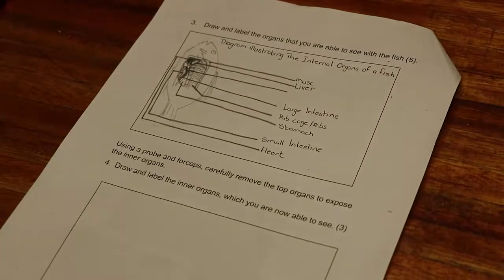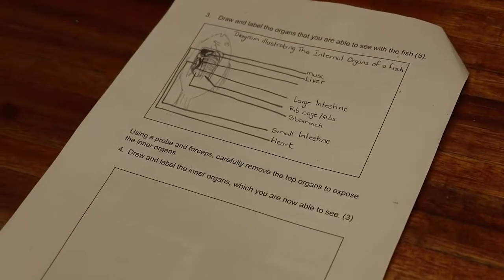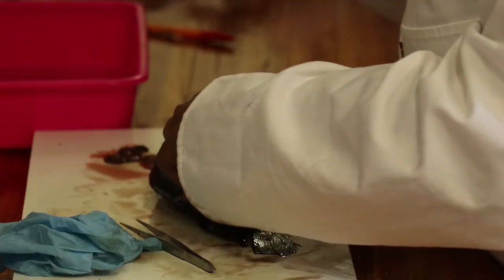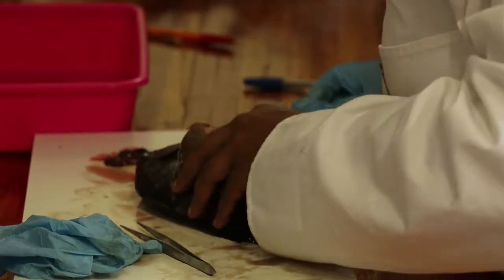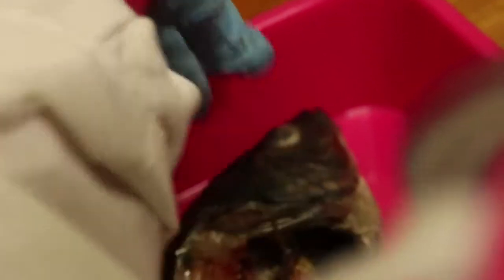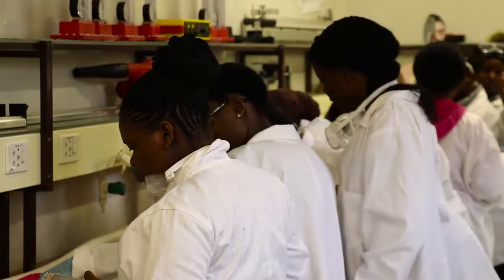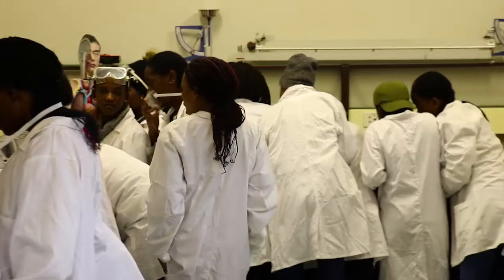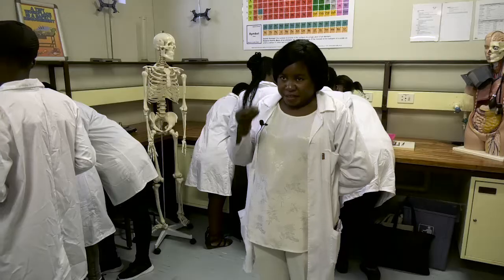The fish represents all the other vertebrates, so that students understand exactly what an organ looks like — the different organs that are found in a vertebrate and the different organ systems that are found in a vertebrate, in a real life situation. In science we don't believe in just teaching people theory. We want them to see and experience what they learn in class, so this practical is meant to enable the learners to see the structures that we learn in theory in real life.